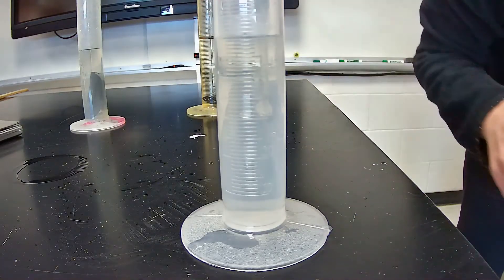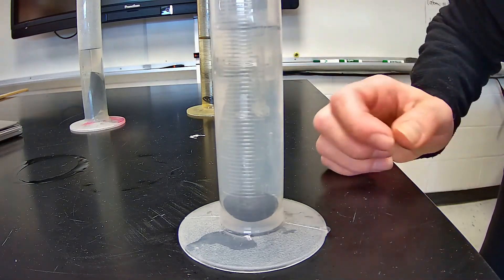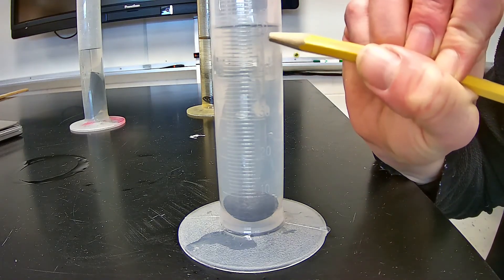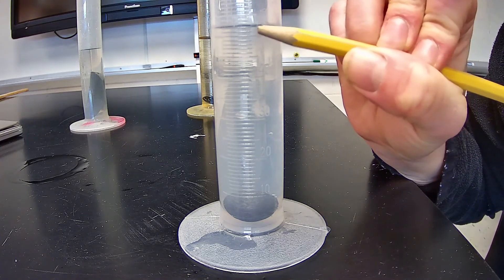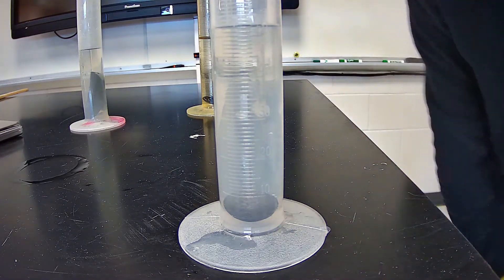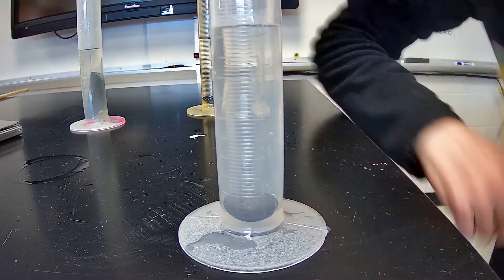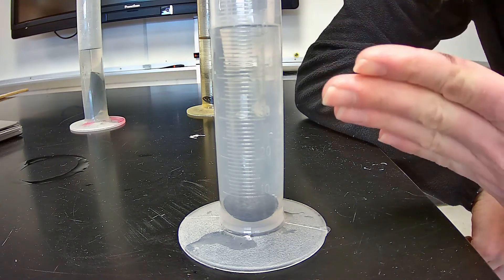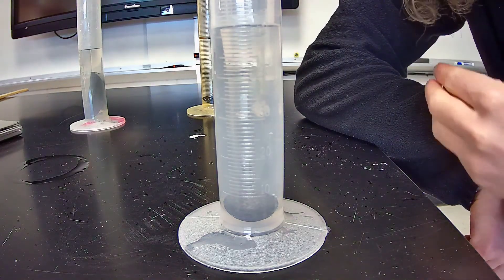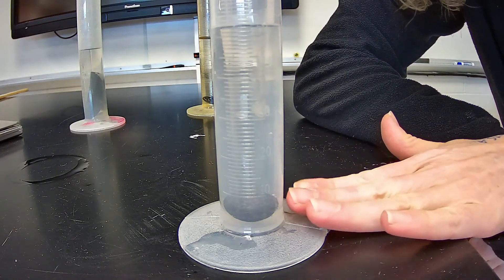Here is the final graduated cylinder. I'm going to put our sample of lead in — it also has a starting volume of 50 milliliters. The volume increased more than the other samples. Counting up from 50: 51, 52, 53, 54, 55 — go ahead and write in your own volume reading. Remember, with this instrument you should record something like 52-point-something, because you can distinguish between milliliter marks and you always add one more estimated digit. This indicates to the reader how precise and accurate the instrument you used was.